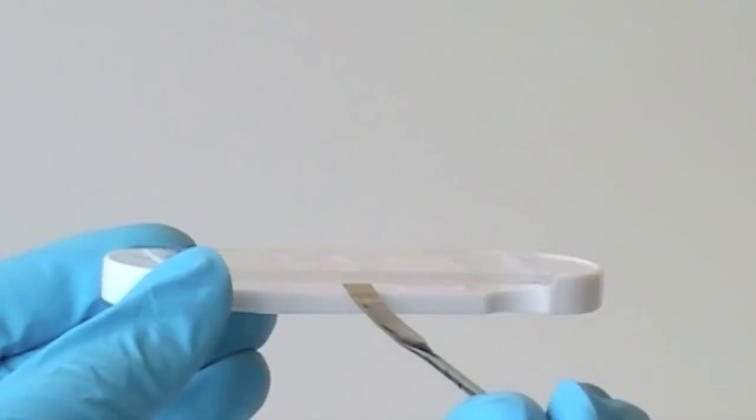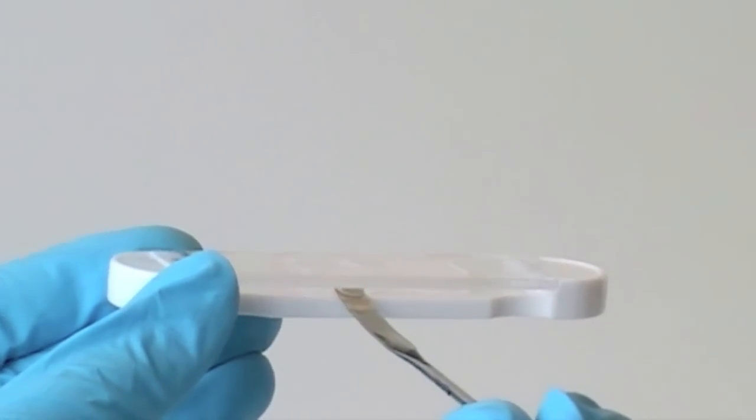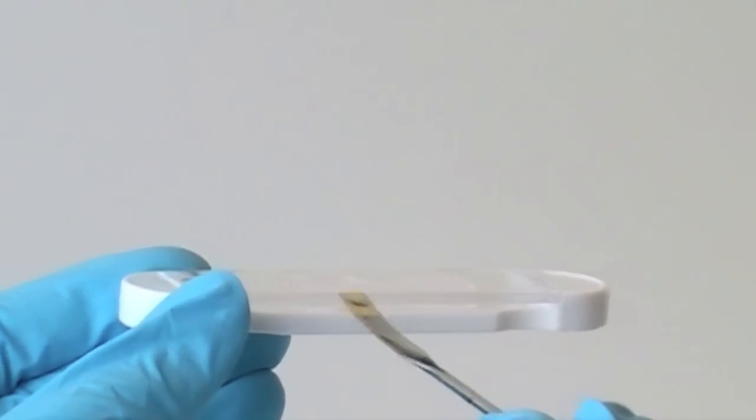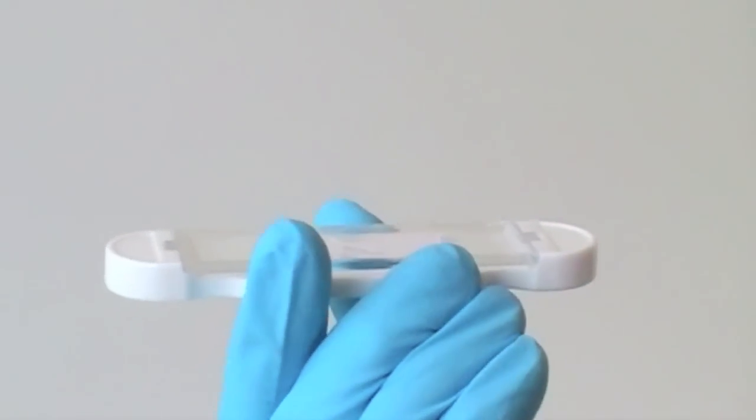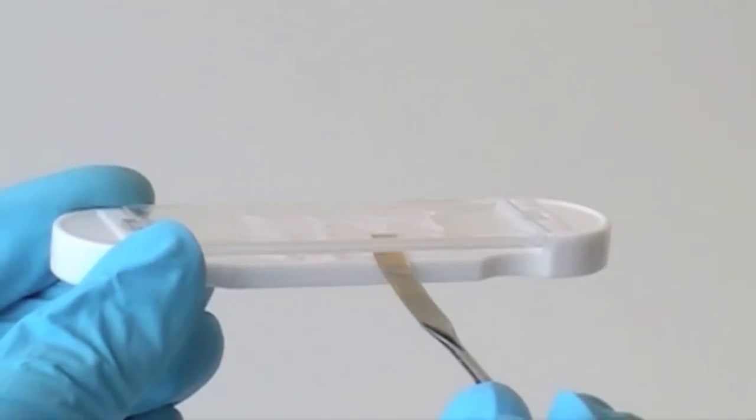Scrape lightly against the slide to make sure the gel is fully detached. Repeat for each gel. When you are finished with one side, turn the caster and detach the gels the same way on the other side.